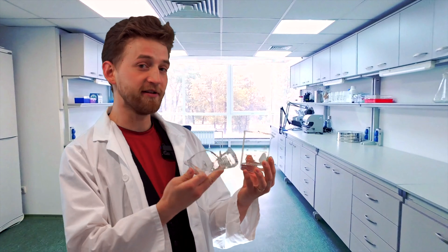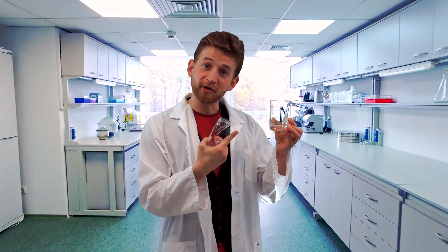What you can do is safely handle hydrochloric acid if you take the proper precautions. Having hydrochloric acid on hand is a lot of fun, and if you're into chemistry, you'll probably get to the point where you have hydrochloric acid right in front of you and want to play with it. So let's go over exactly what you can and can't do with it.